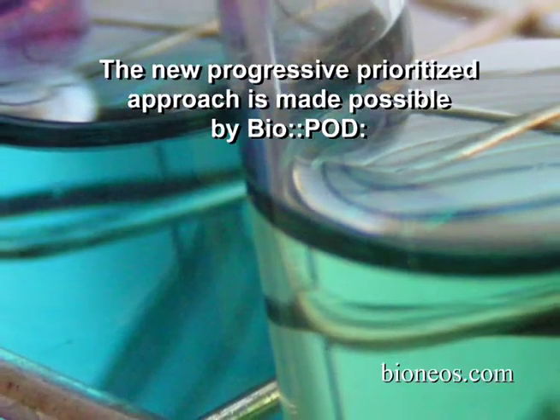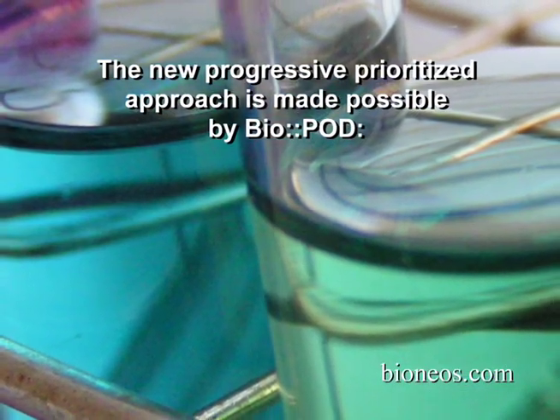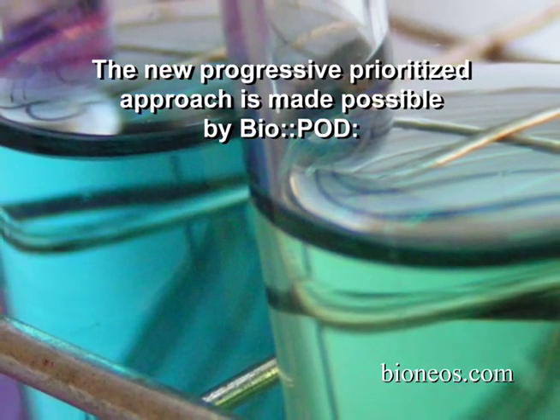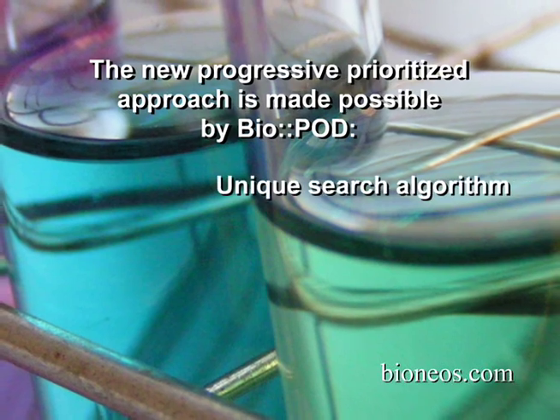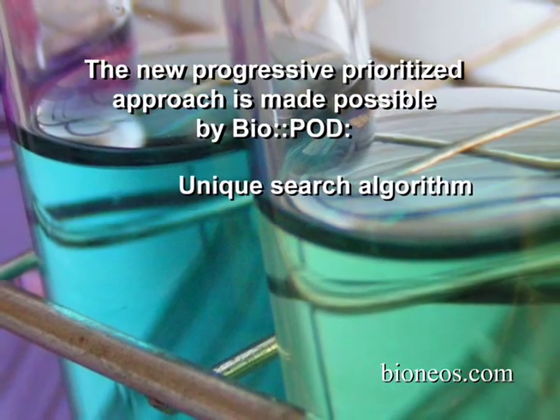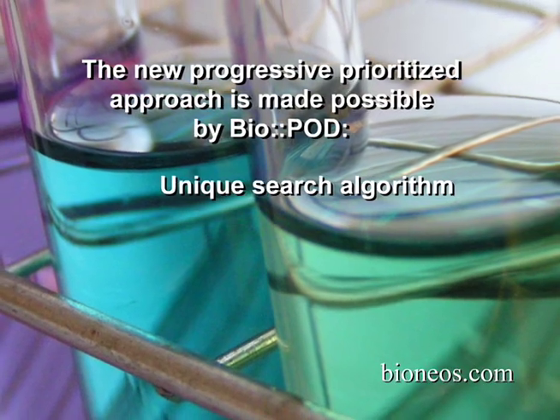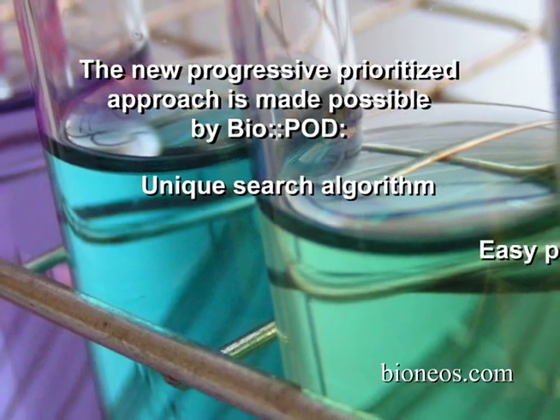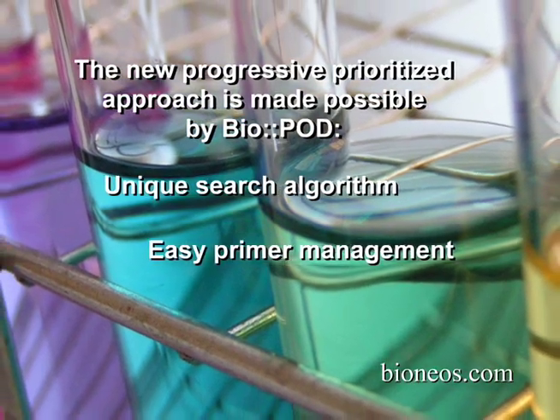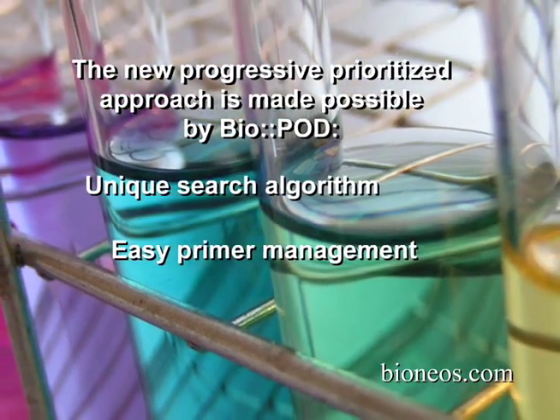Biopod makes a new progressive prioritized screening approach possible by answering the two important questions mentioned earlier. The question of where to screen is answered by the green PAR regions powered by our unique search algorithm. The question of management is answered by the ease with which you can design primers, save them, and mark their success status for future reference.